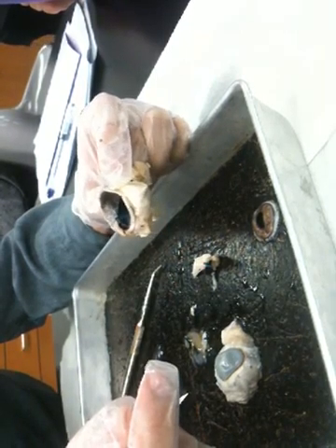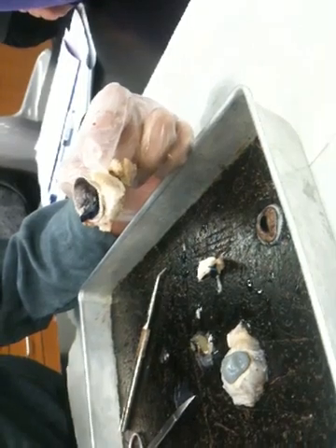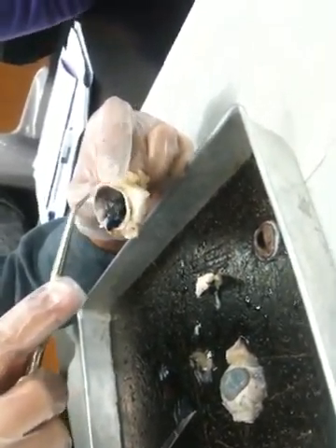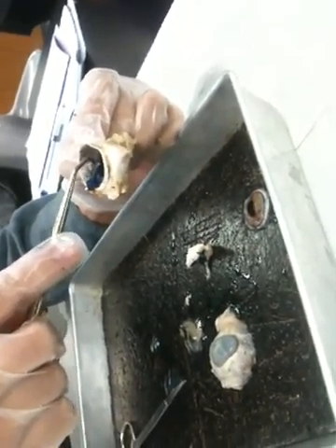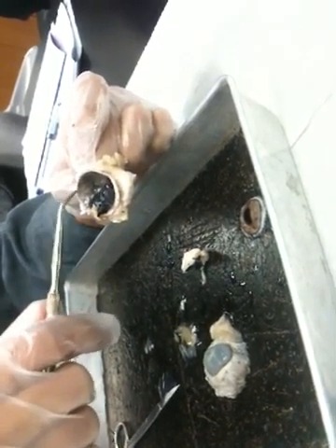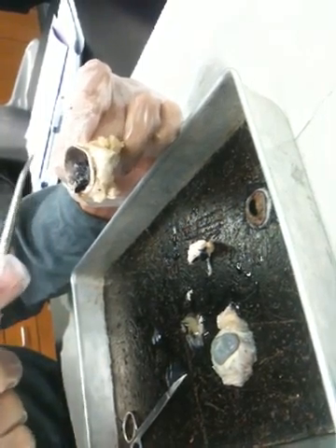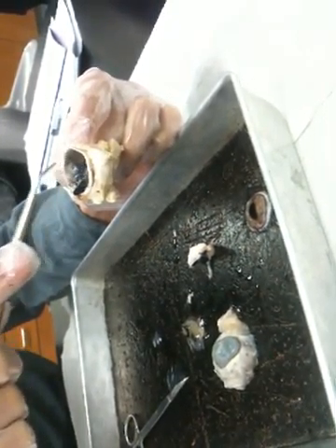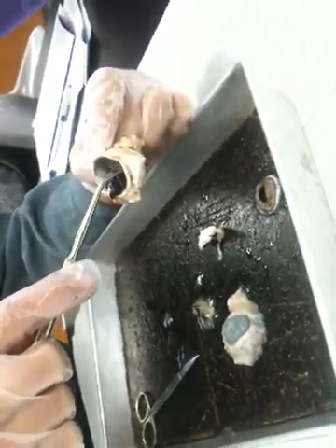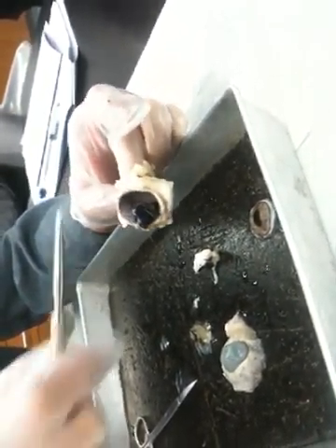So I'm getting a portion of it peeled away so that you can see the underlying kind of whitish gray layer that's behind it. That would be the sclera, the outer hard layer. You can see the white ridges of sclera pretty much all the way around. It's the thickest, toughest layer of the eye. And then this thinner black layer, the choroid, lies atop that. And then on top of it all would be the retina. The black layer is continuous with the ciliary muscles and ciliary body in the front of the eye, and the outer white layer here, the sclera, is continuous with the cornea.